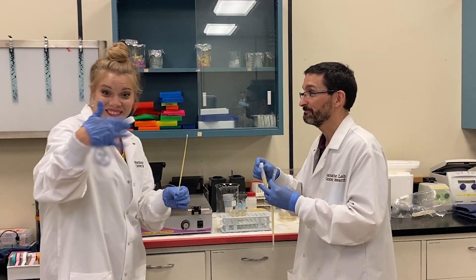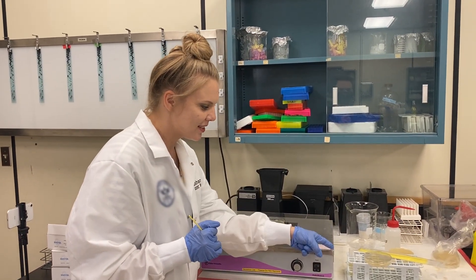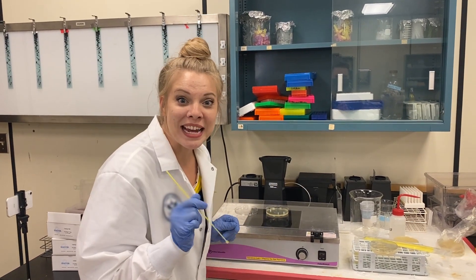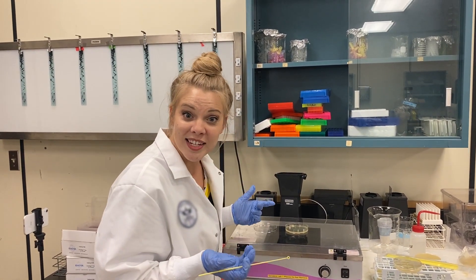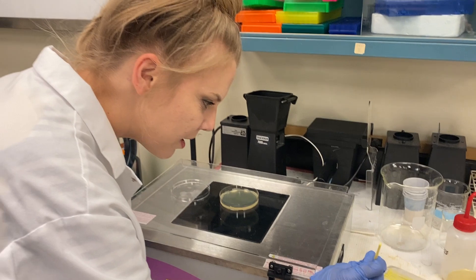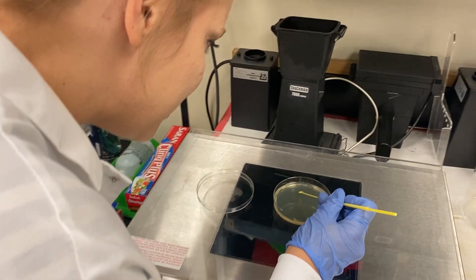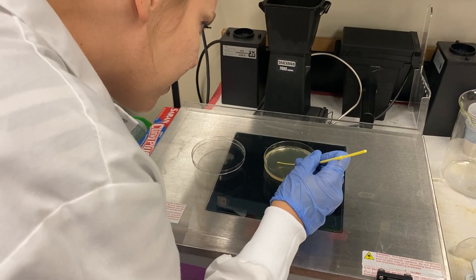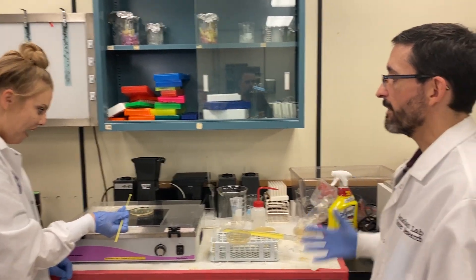Okay, let's do it. Got my brush — wand. Got my canvas — petri dish. And got my paint — cells with glow in the dark DNA. I love science. What should we paint on our first canvas? How about a circle? There are cells on my wand right now, but I can't see them. And they're alive, too. Hi, buddies! Perfect. That's it. Now we just wait for them to grow?